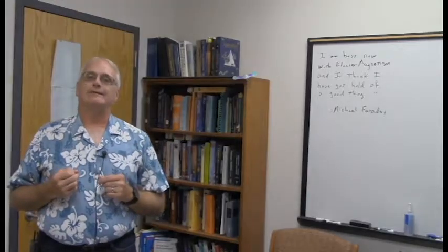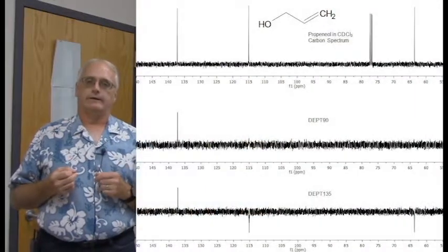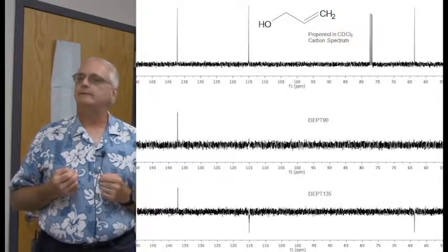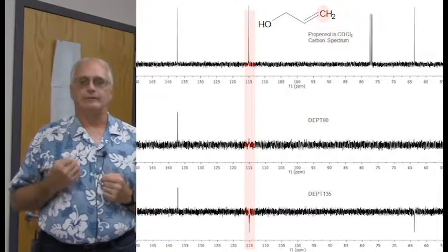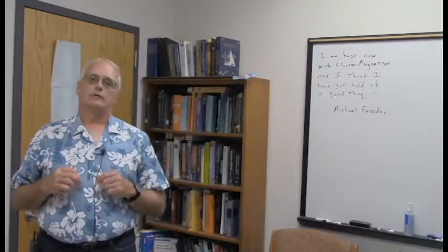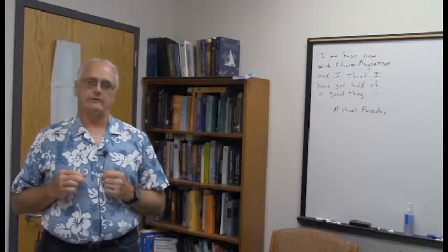Now to really dig into this pattern, you take a look at the DEPT spectra, and they beautifully show just the 3 carbons, and they identify here at right around 115 ppm the CH2 group of the terminal alkene. So there's our friend, the methylene group that we are interested in looking at carefully. For methylene groups, our other really good friend is the two-dimensional HSQC spectrum.